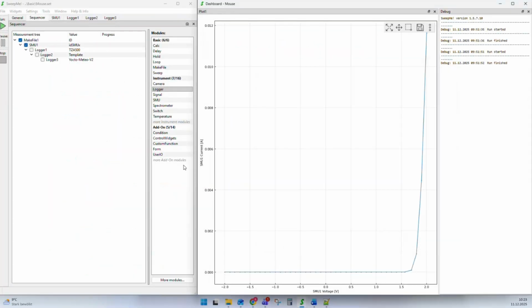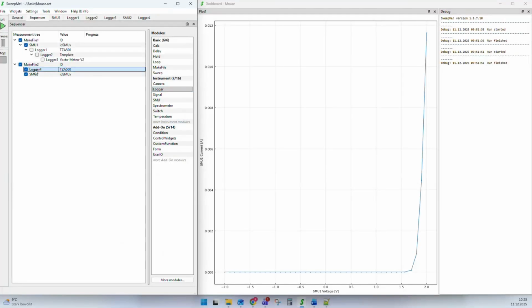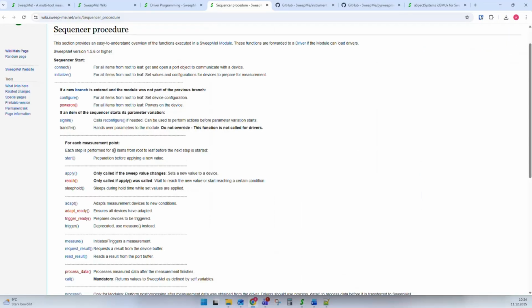Let me open SweepMe again. You can see we have one branch here, but I could also have a second branch with another instrument, with different other instruments and so on. It is also possible that we can have sub-branches, right? So that you have first one branch, a second branch, and a third branch. And this means, when we go back to our scheme, we now have functions that are called by SweepMe when your module enters an active branch. It means when your instrument gets really active and has to do something in a branch.